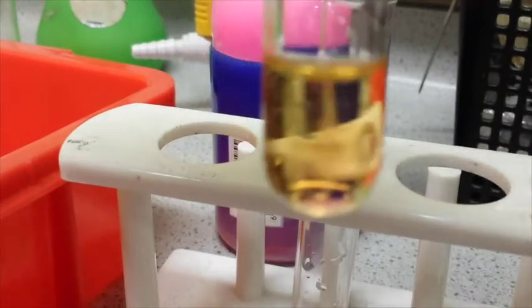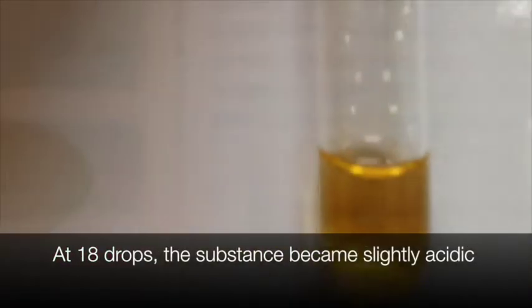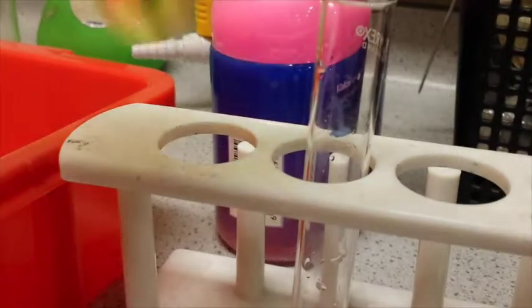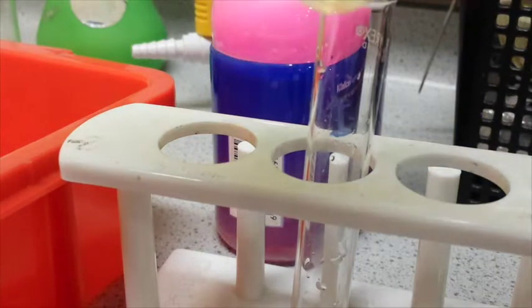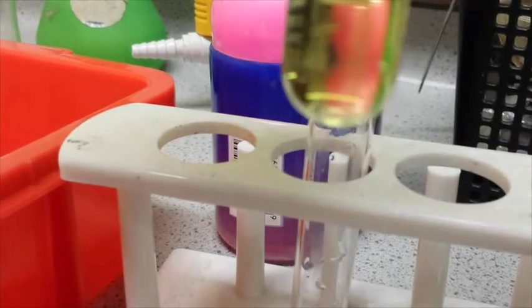18. Oh, look at that. You can see it became slightly acidic already. You can see by the color change. So should I still add more? Of course, because we're looking for change. 18, 19. Okay, there you go.